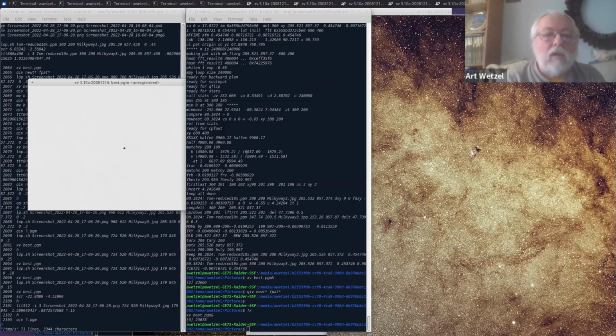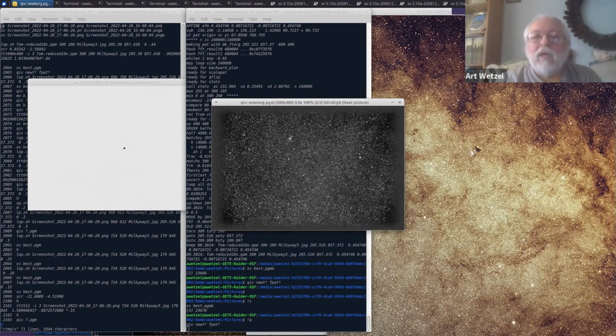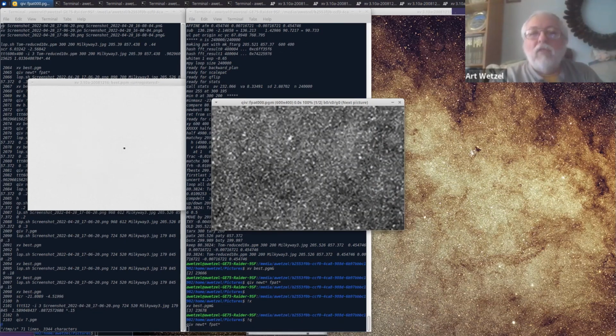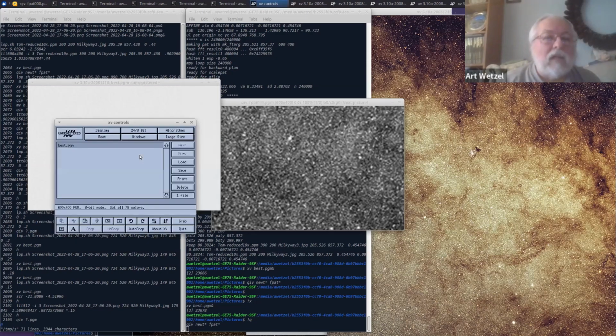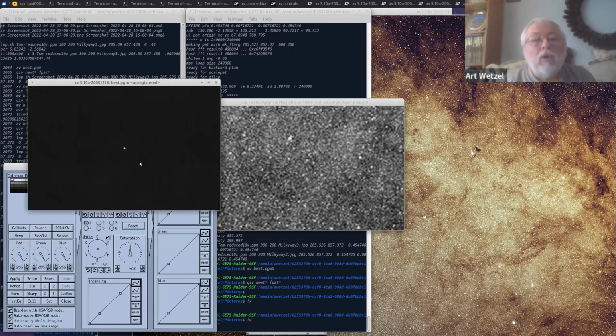And if we look at that spot, what that is doing is reproducing very closely the point spread function of the stars in the worst of these two images. Really, it would be sort of a product of the two distributions between Tom's shot, which is this one, and this other shot, which is here. And you notice the stars in this shot are not points, as they, of course, should be, but are a little bit diffuse. And so the correlation spot, or the match spot here, if we invert that to maybe make it a little clearer, is reproducing essentially the point spread function of the stars, the shape of the stars as we see them here. Okay?